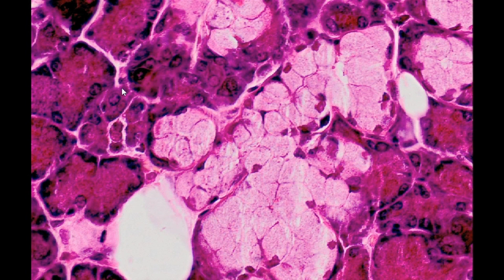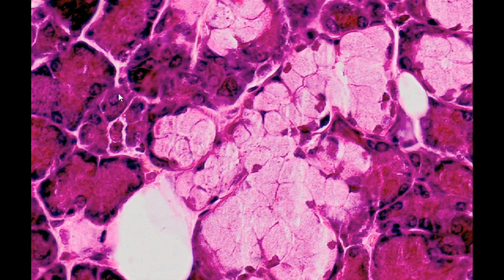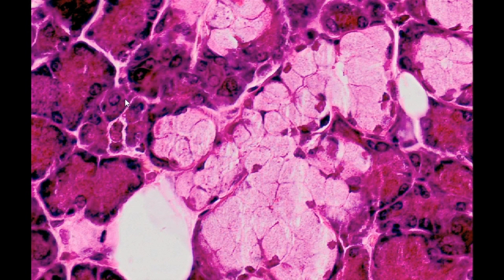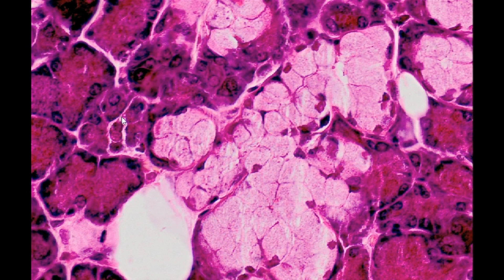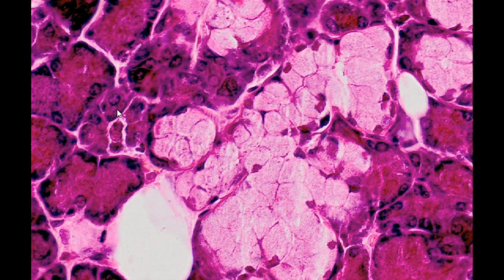In turn, serous cells contain a centrally located round nucleus and zymogen, which causes the granules to stain intensely.